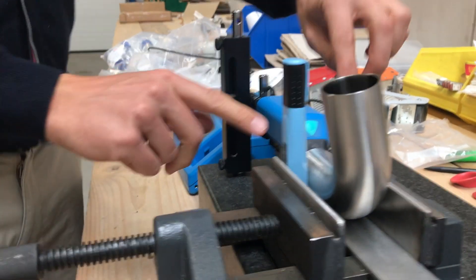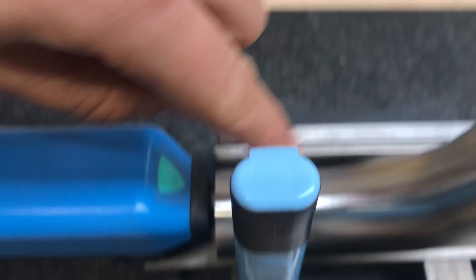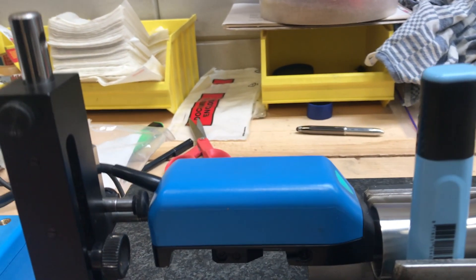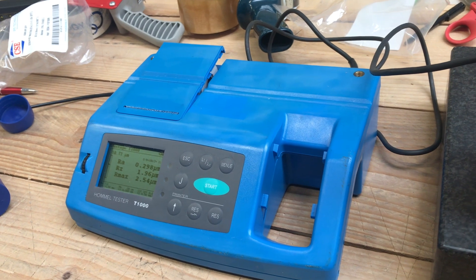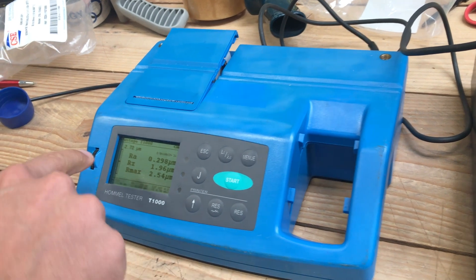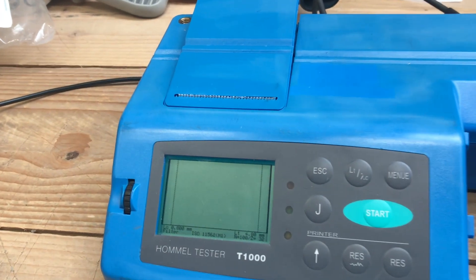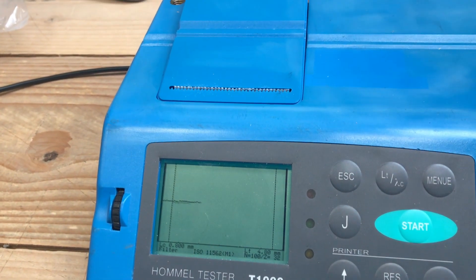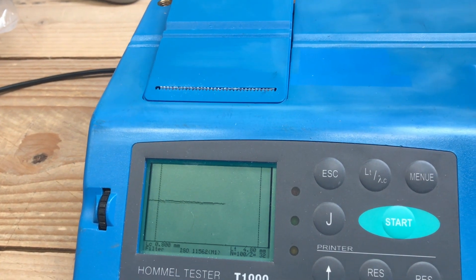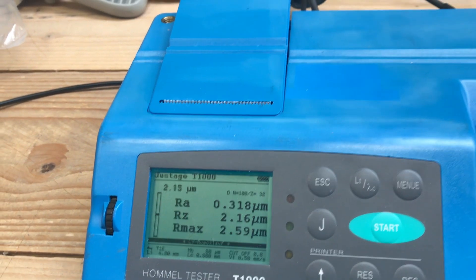Important: we have to be very straight here. This elbow has to be straight and the measurement has to go completely straight inside — no right or left. Now we make a start, level down again, almost in the middle. 2.73. 0.3. 0.318.